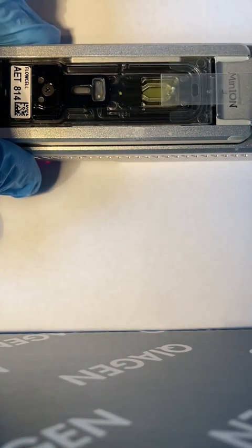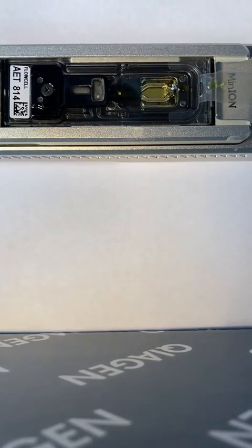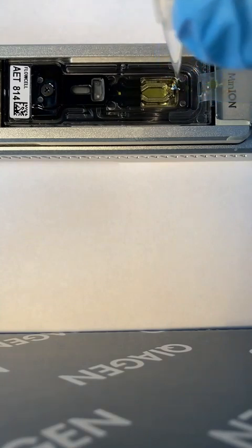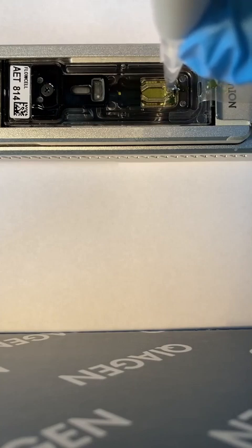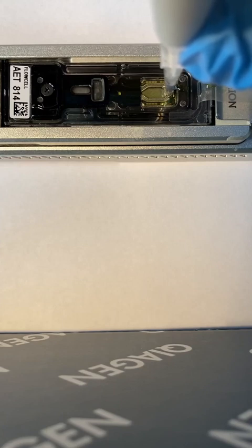And I think the technique here is there's a little sample port. The technique is to slightly put pressure on it, but to almost point the pipette tip back towards you. And you can kind of see that in that other video that Oxford Nanopore produced, the previous one, but they don't really tell you that. So here it is with the tip going in. You're going to see me kind of put some pressure on it and bend out away from me, and I'm kind of pointing it towards me. And you'll notice there's a little bit of fluid actually moving through the outside of that. You can see it moving there. So this one went in.